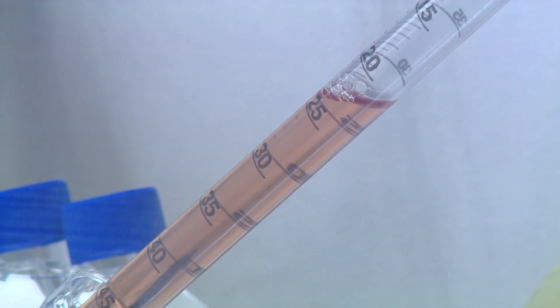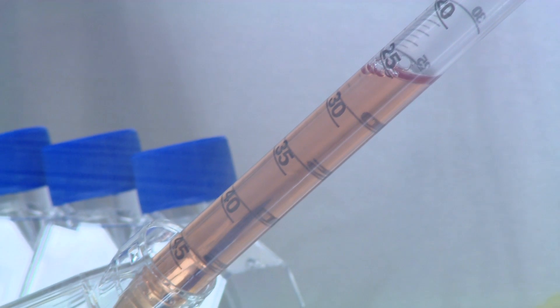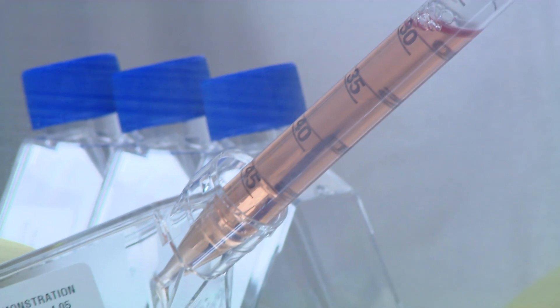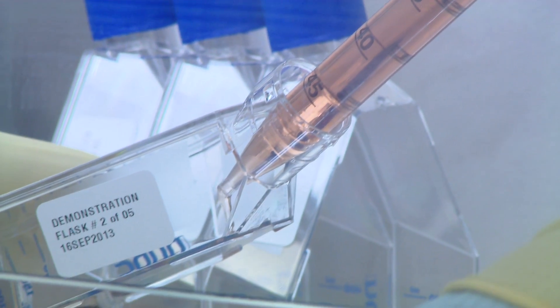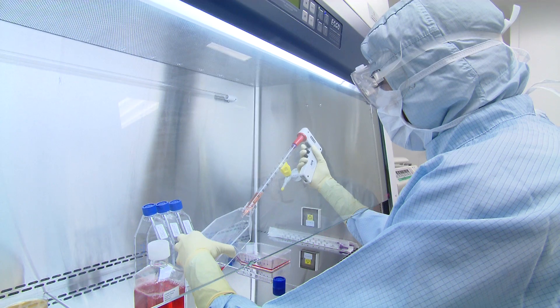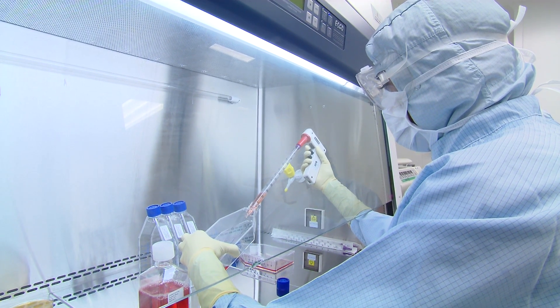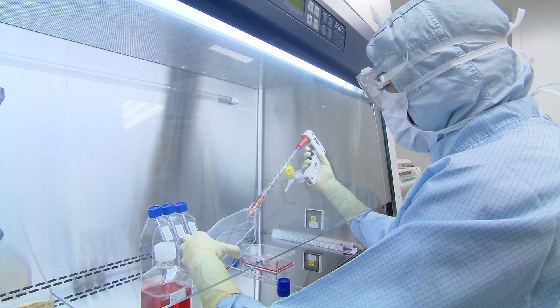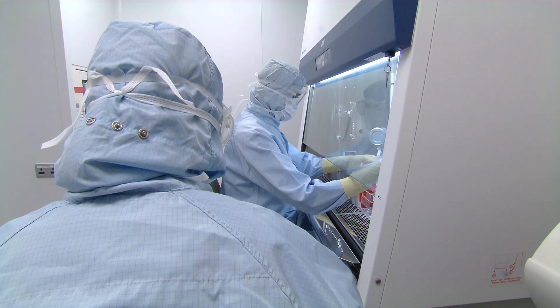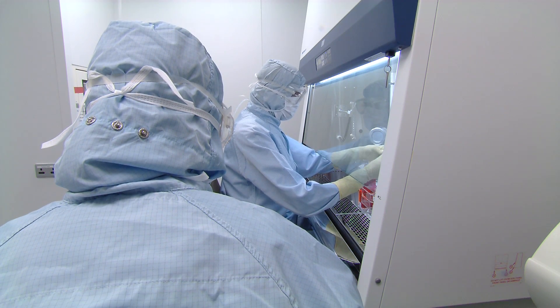The stem cell technologists themselves manufacture the stem cells. They harvest them, add media, bring the culture to its different passages in terms of growth, check it for viability, and move it on to the next stage. This is a process that runs over three to four weeks.